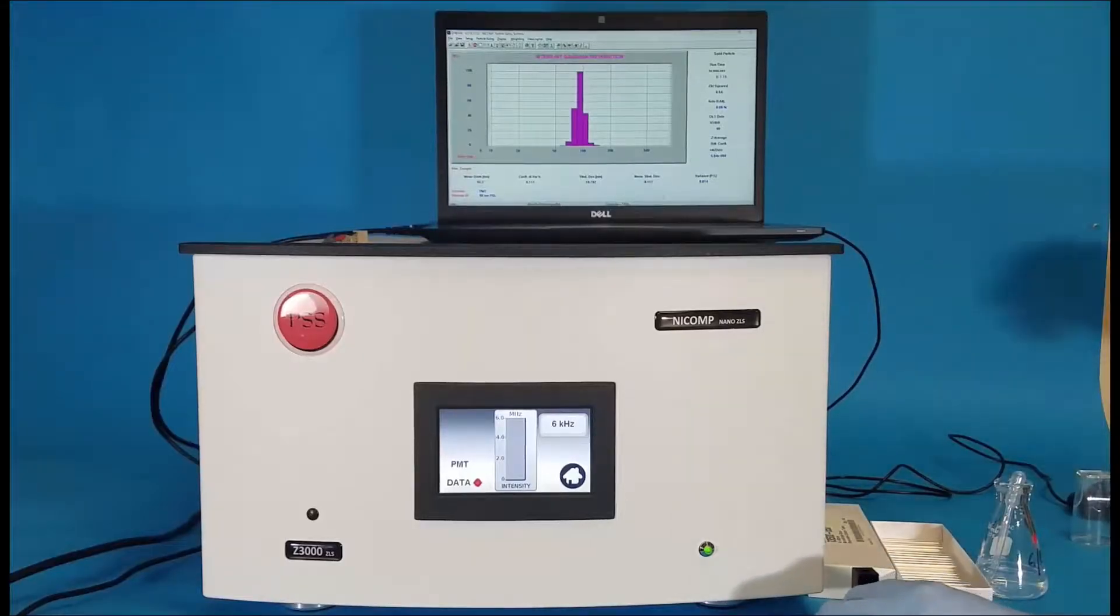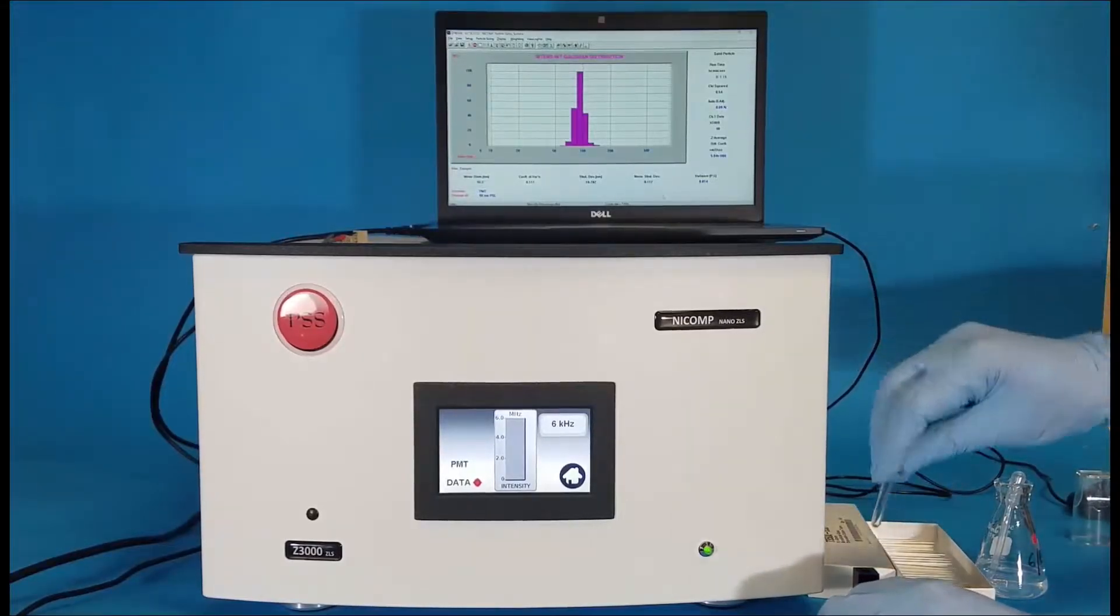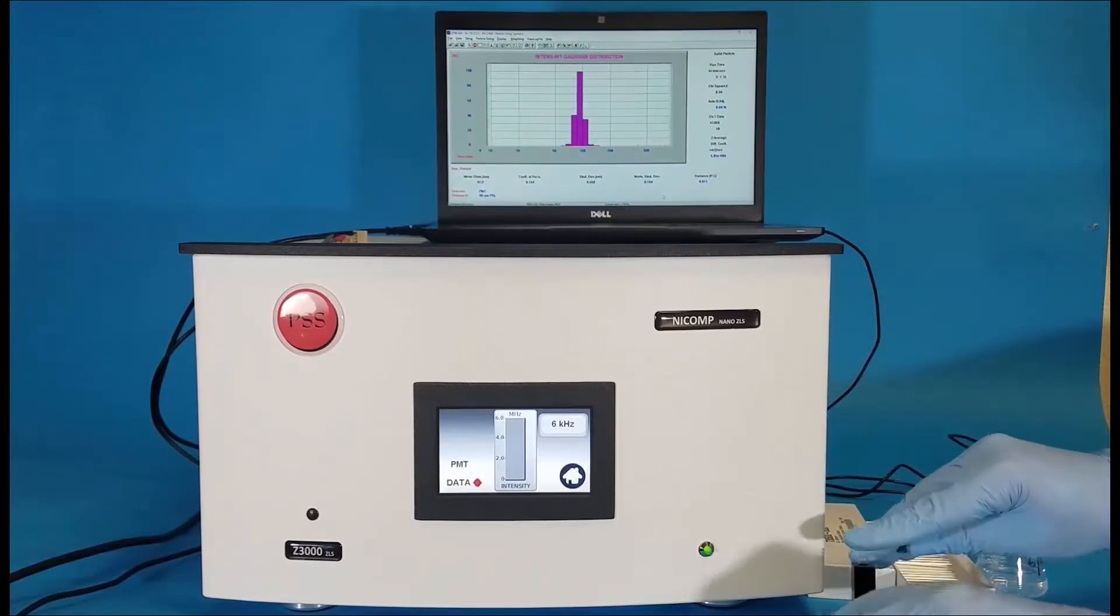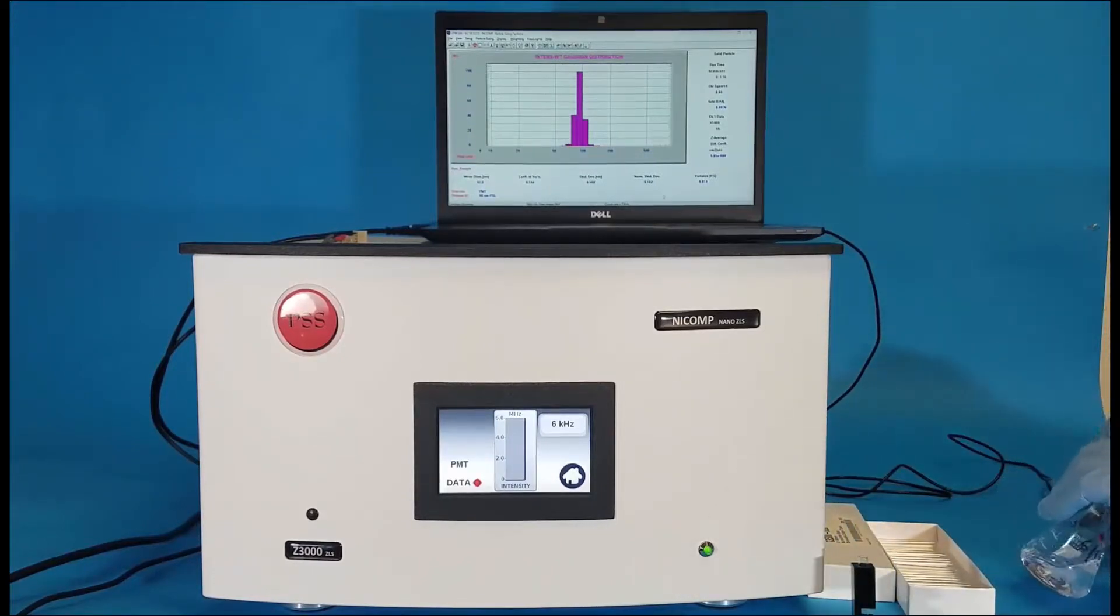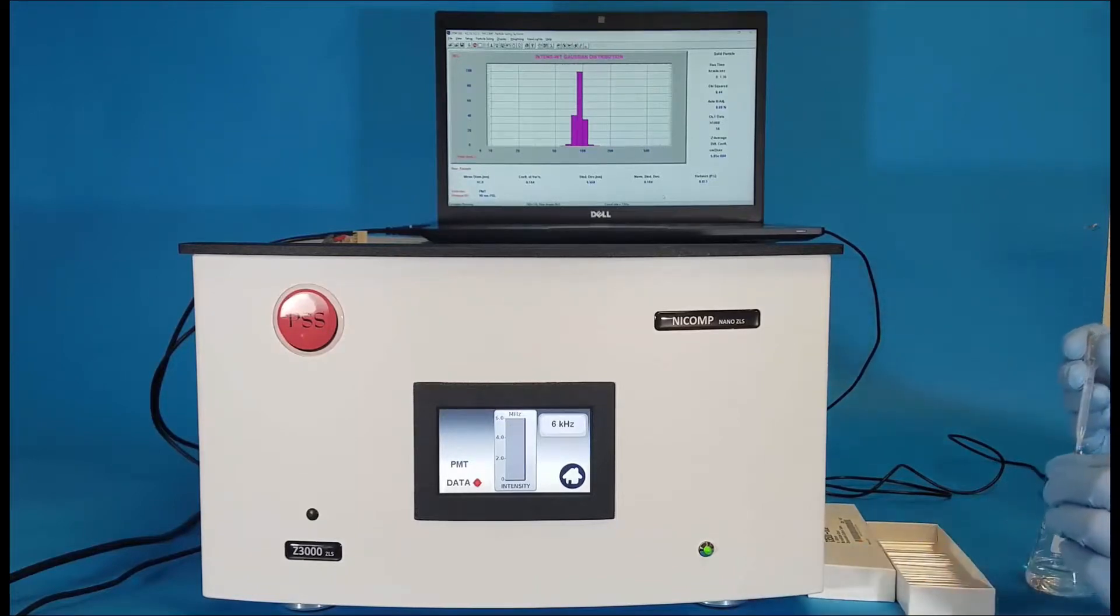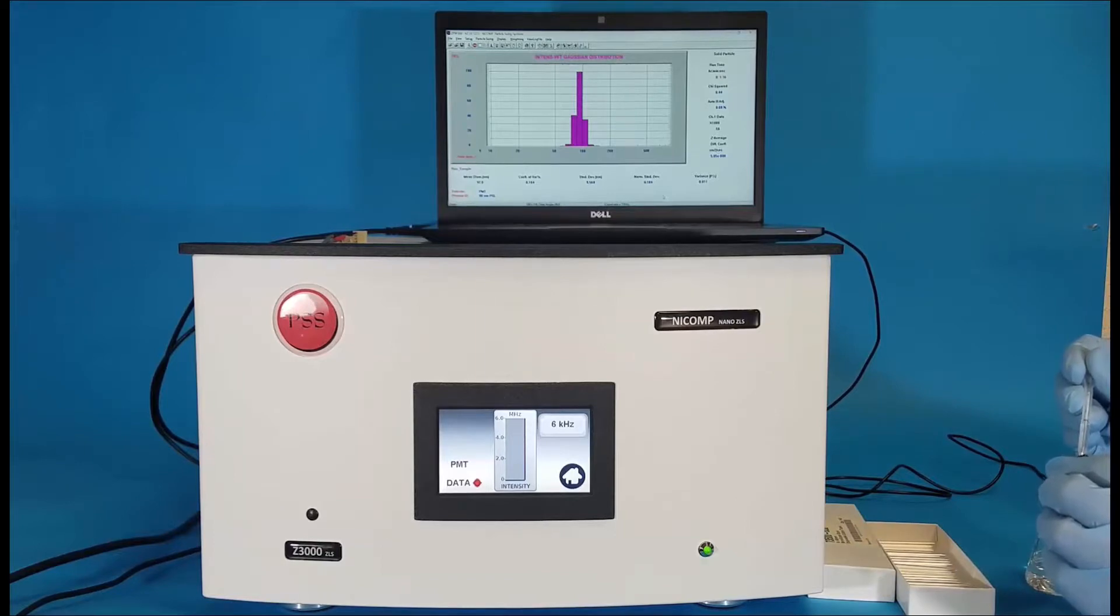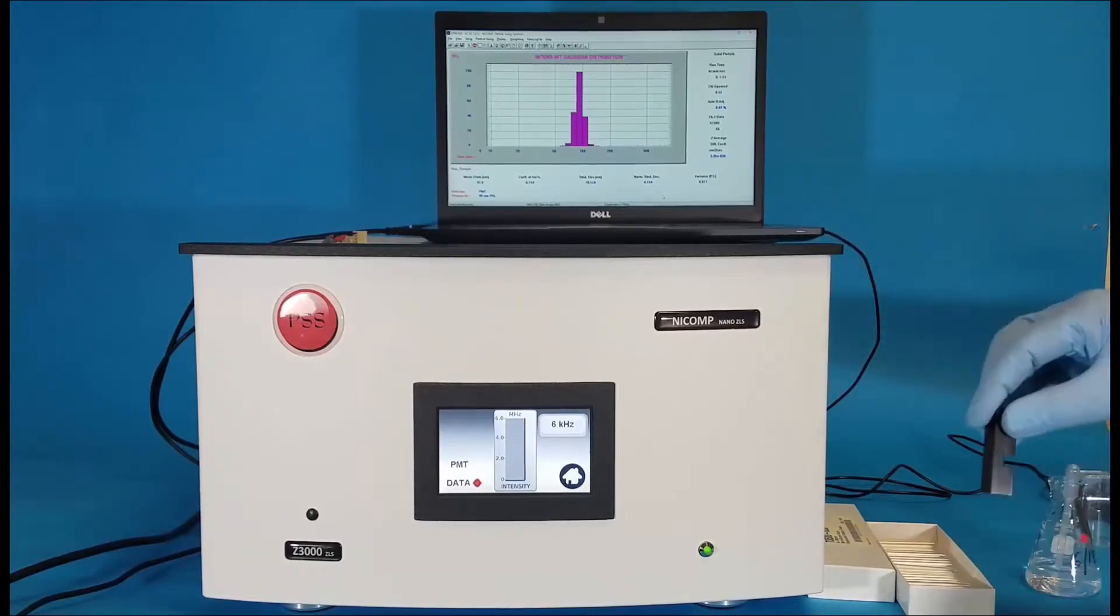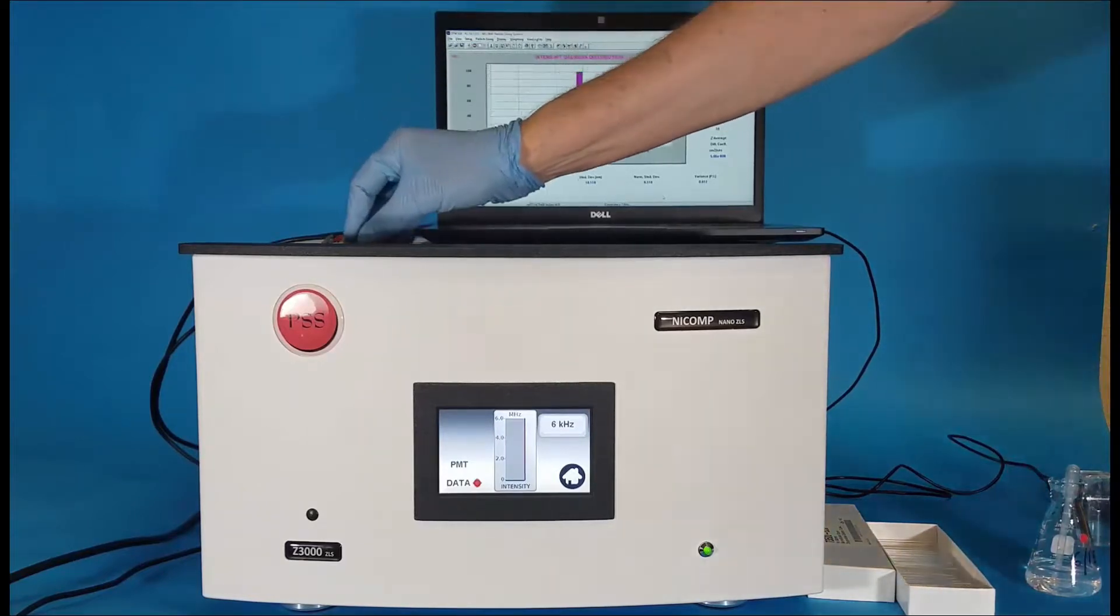Here I'm going to use the round glass cells in the black cell holder. I place the tube into the black cell holder. I'm going to pipette the standard into the cell so that it is above that cutout where the measurement is made. Then I can take this cell and load it into the instrument for measurement.